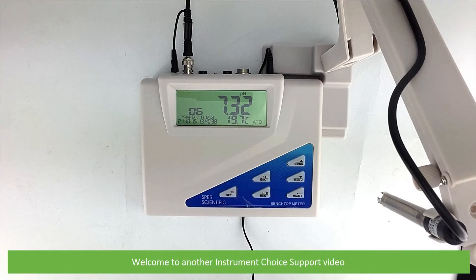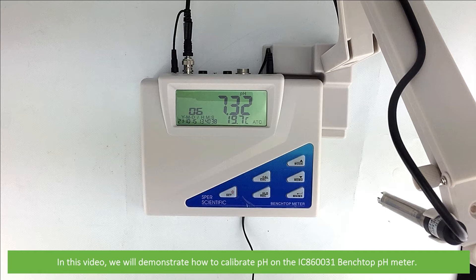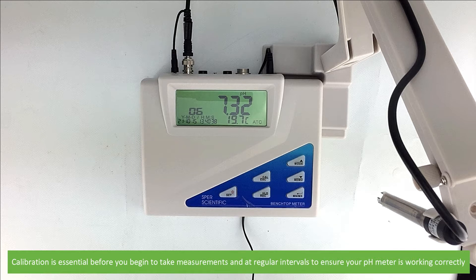Hi and welcome to another Instrument Choice support video. In this video, we'll demonstrate how to calibrate pH on the IC860031 benchtop pH meter. Calibration is essential before you begin to take measurements and at regular intervals to ensure your pH meter is working correctly.